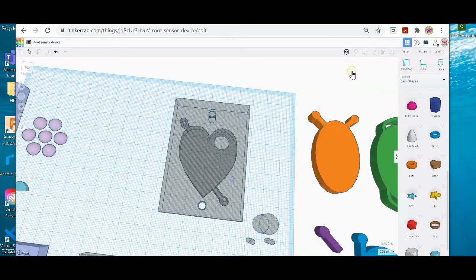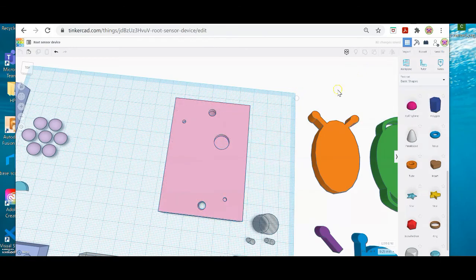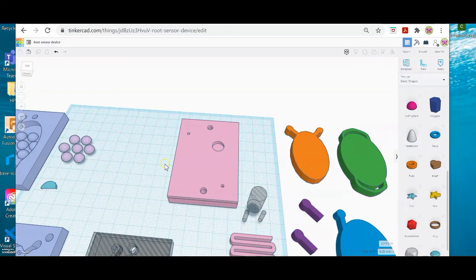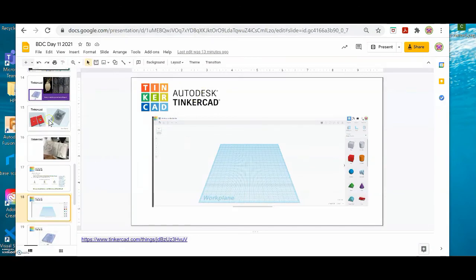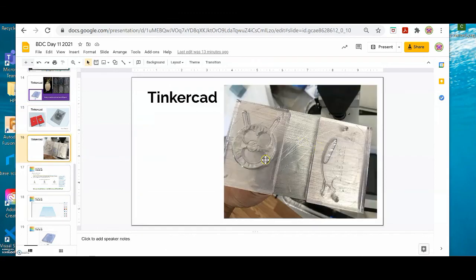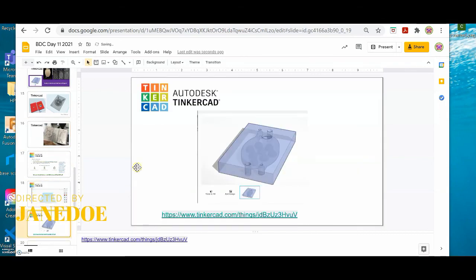Okay, so good luck with your designs. I will deconstruct this so we're all working from the same base plates and same parts from this particular file. And I wish everyone great luck on their designs. And again, this is what you're doing in Tinkercad, a base and a top, you're sliding them together, and then we're going to print them in clear SLA resin, and then you're going to plant a seed in here and we're going to watch the roots grow. So thank you guys for your time and good luck.